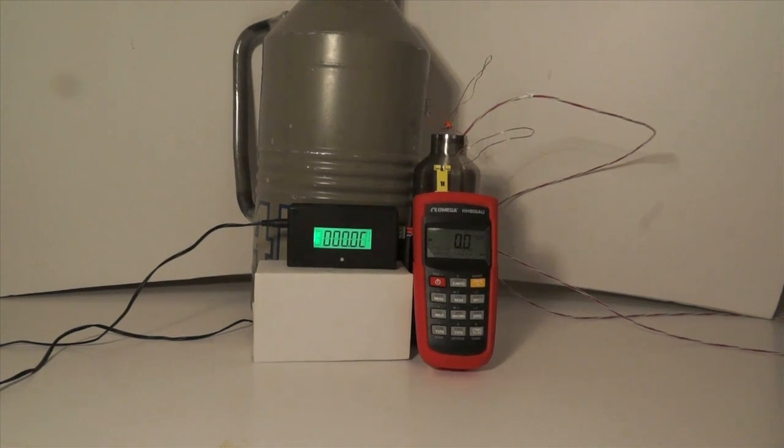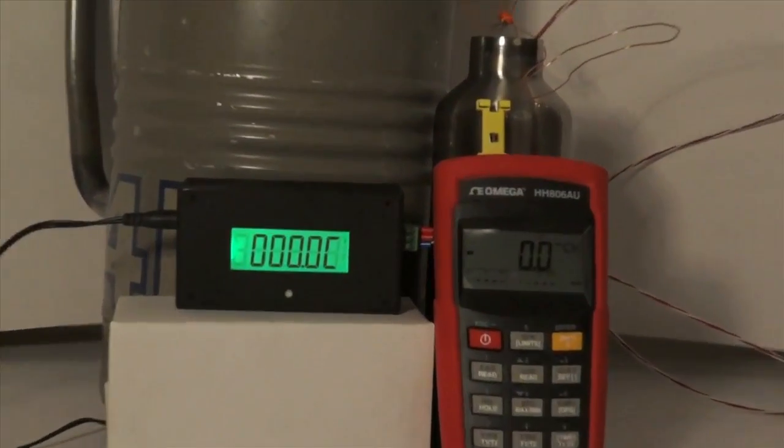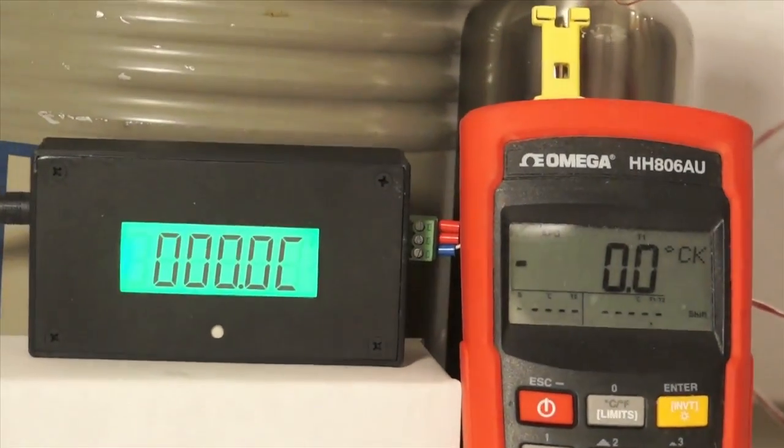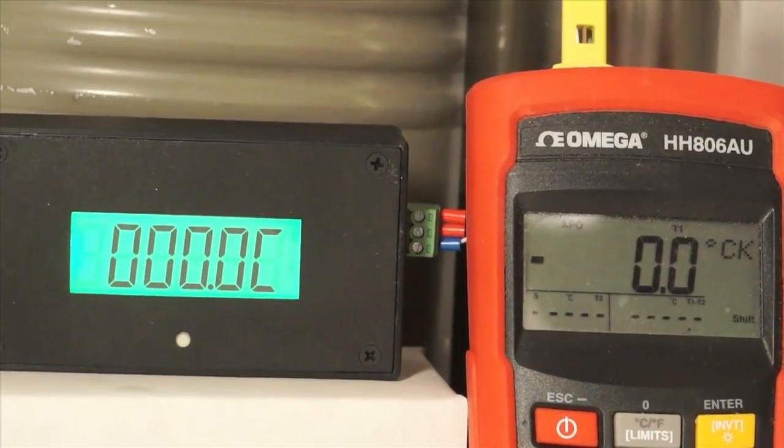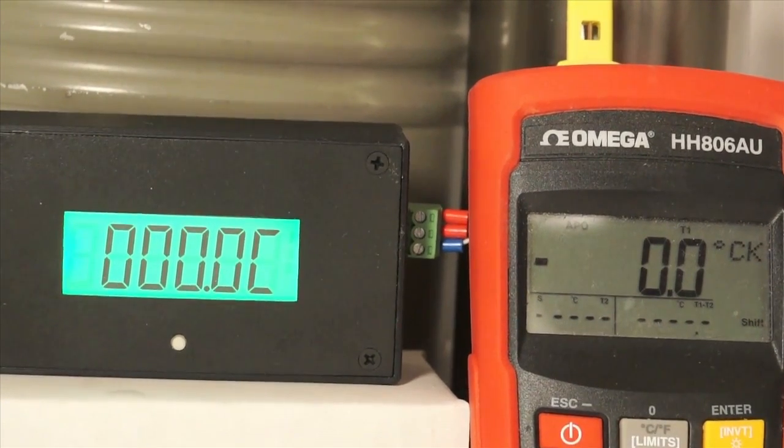You'll notice the ice bath and a liquid nitrogen bath here. Right now I have both probes in the ice bath and are reading very comparable temperatures. You'll notice they're actually both reading zero centigrade.